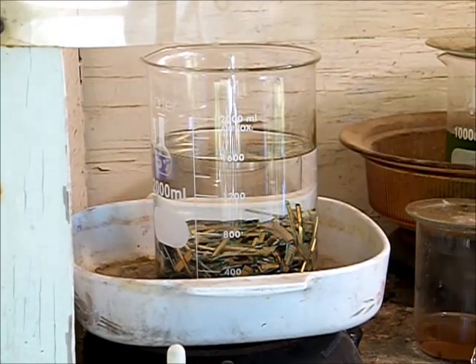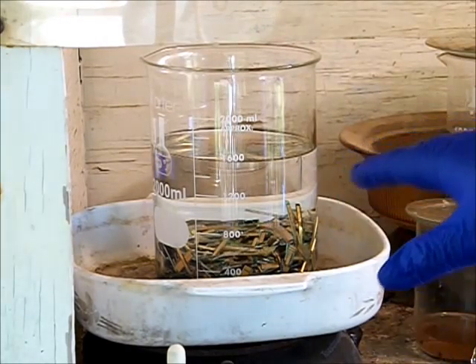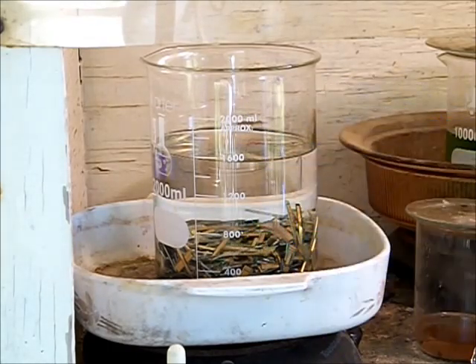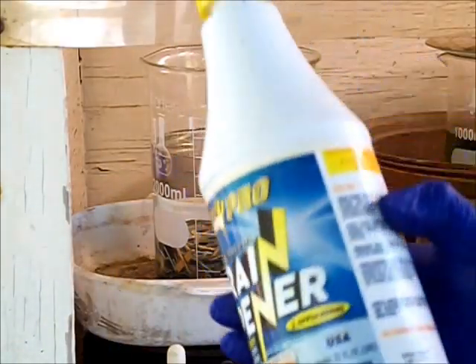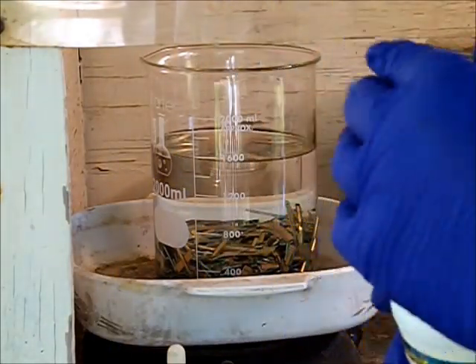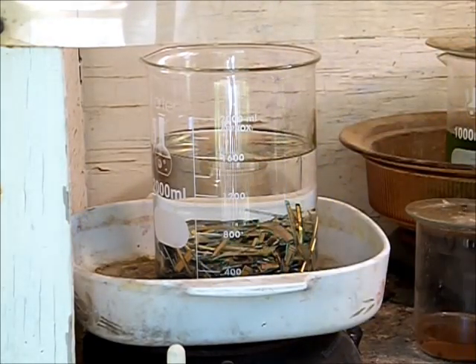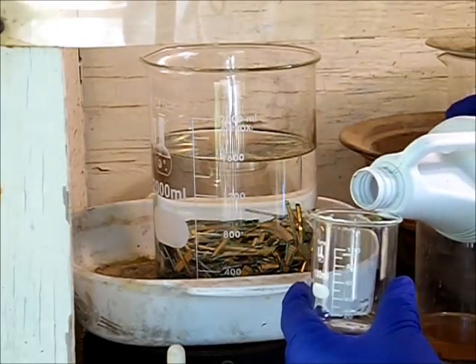For this amount of water, and I'll probably add another 100 or 200 mils of water as it goes along, I take my sulfuric acid source and measure up 100 mils.